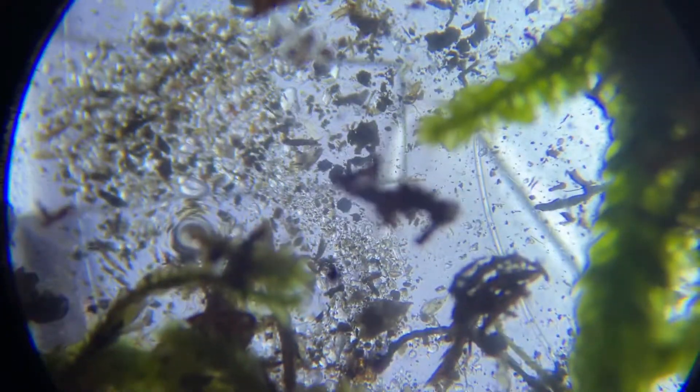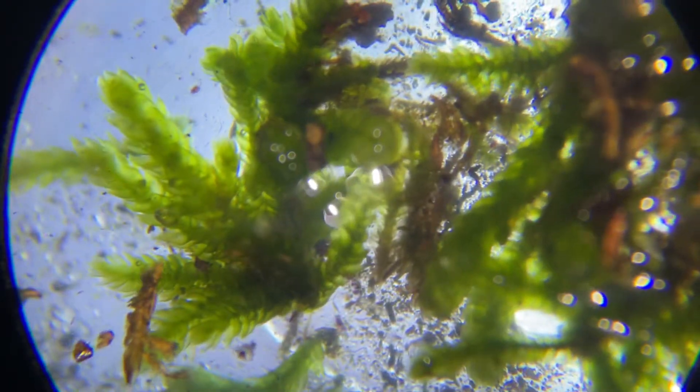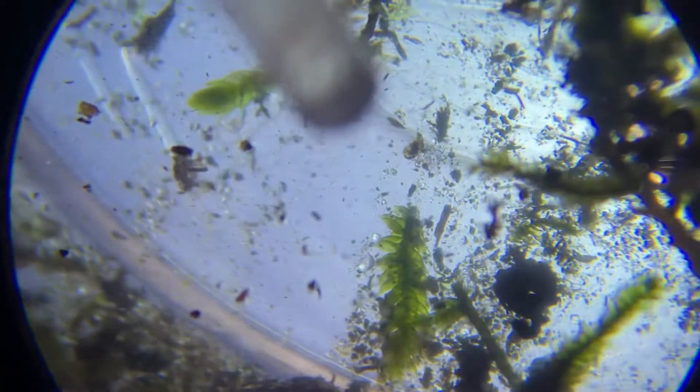That's what you're looking for — something moving. I just saw a little mite. You can see my pipette here moving stuff around. When you go into focus, I'm trying to focus on the gravel down here. I hope you appreciate the value of how this works — you don't just grab a tardigrade by the ears and bring it in; this is part of the whole process.